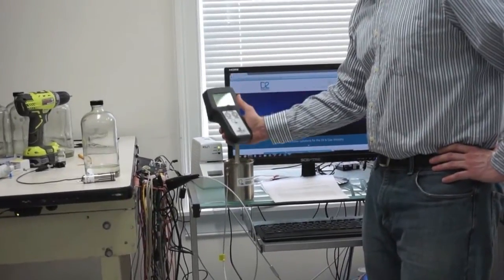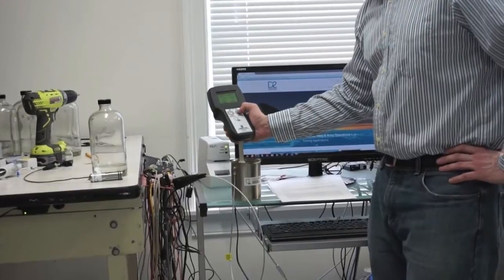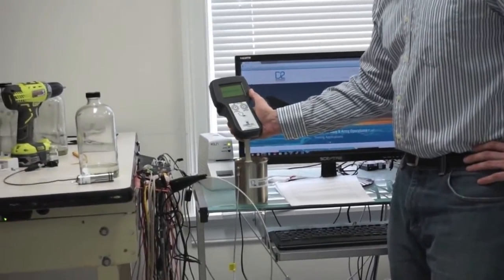Then you immerse it fully, keeping it still, and hit enter to start calculating the result.